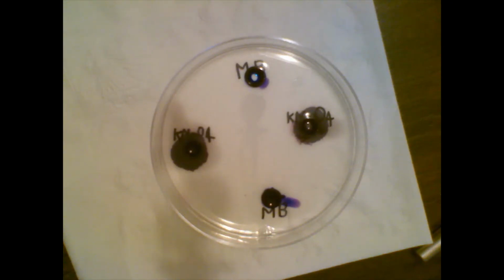The reason is that the molecular weight of potassium permanganate is 158 and the molecular weight of methylene blue is 320. And what relationship can you state between the molecular weight of a substance and the rate of diffusion? The smaller a substance is, the faster it's going to move across a system. If it weighs less, it's going to move faster. So we could say that it's inversely proportional to size. That is for exercise part 1, passive transport.